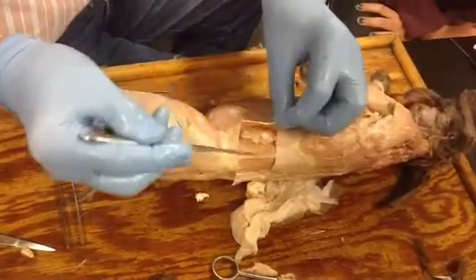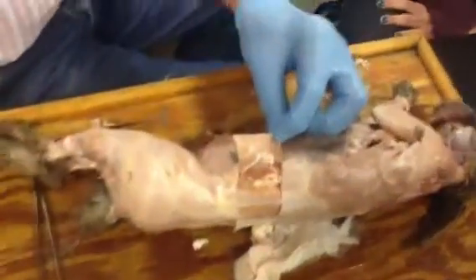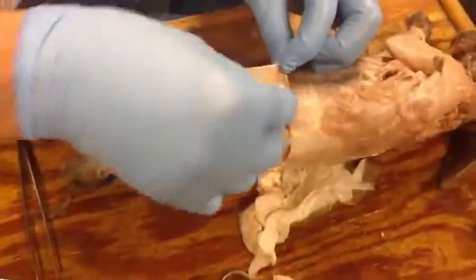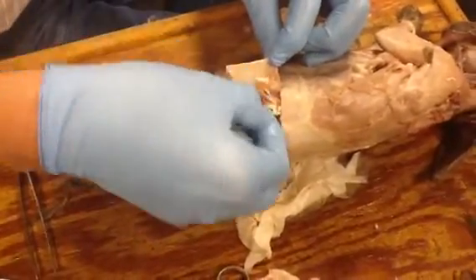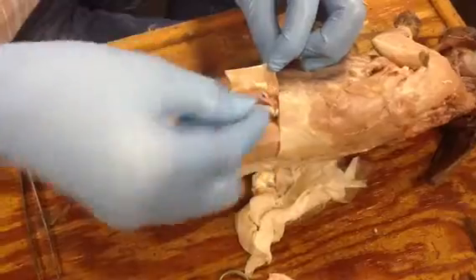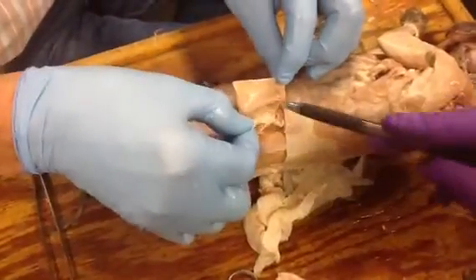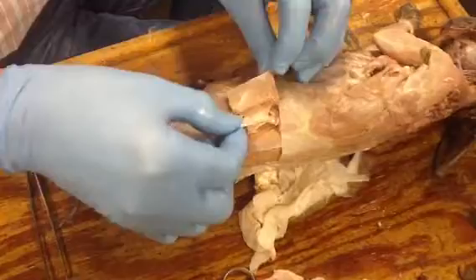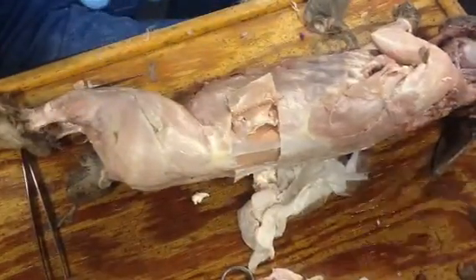And the fibers are going a different direction on each one. Pretty much what you saw on necturus, right? And that's one of the beauties of doing this — that's why we like this. So these are at 90-degree angles to each other? I wouldn't say 90 degrees, but they're different — close to that. Yeah, they're a different angle.